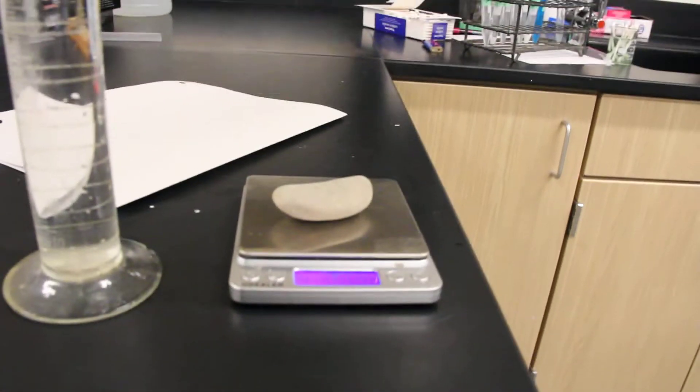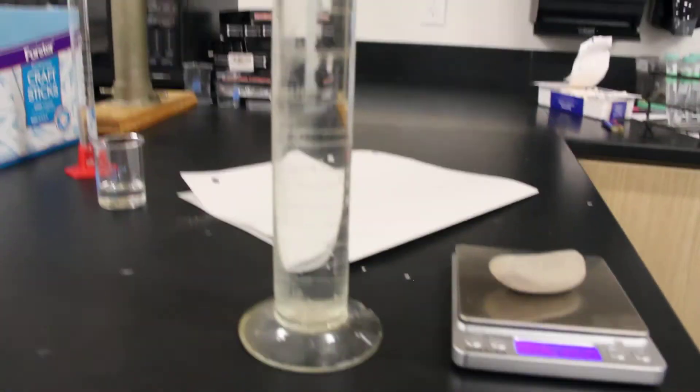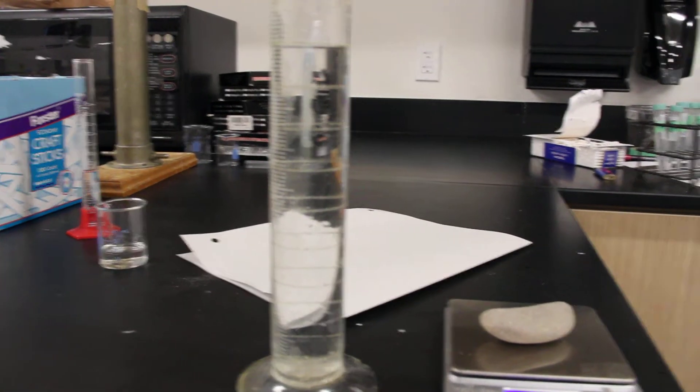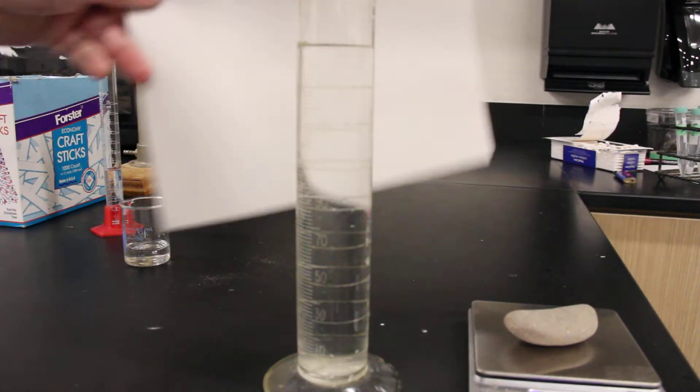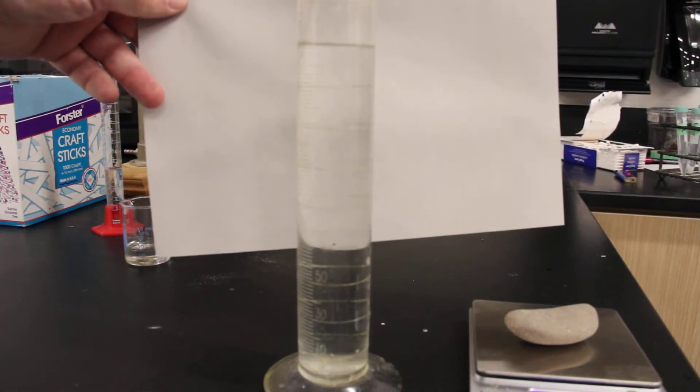53.60 grams. Then I'm going to gently, I have the graduated 250 milliliter graduated cylinder filled up.